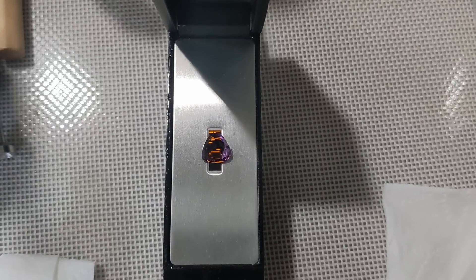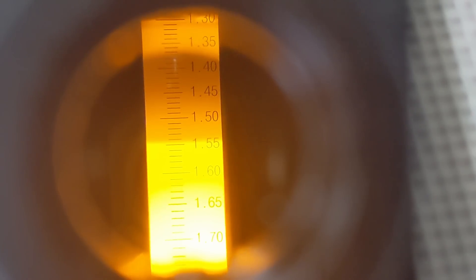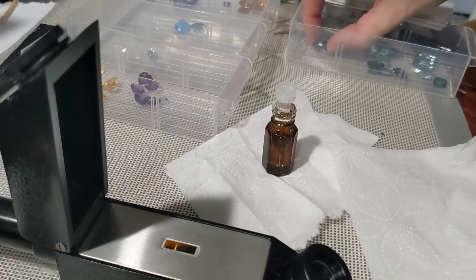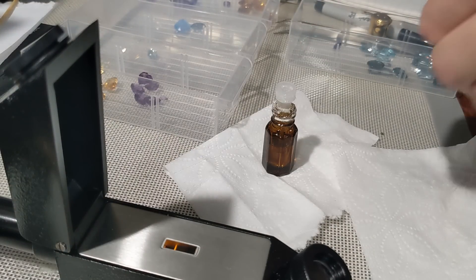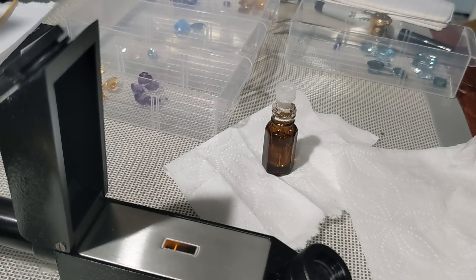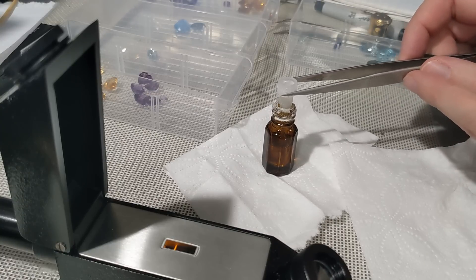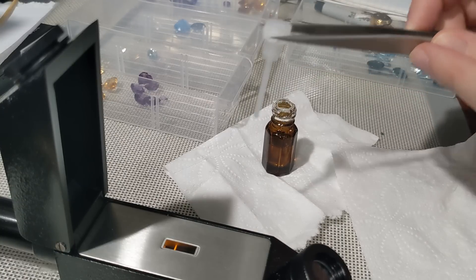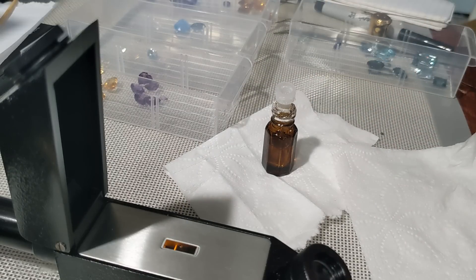If you do get one of these cheaper refractometers, definitely check it against known stones so that you know if it's actually reading accurately, because in some cases that could be an issue. Now there are lots of caveats here: these methods don't discriminate natural from synthetic gemstones. I also only did like one test stone before filming so I'm learning to use the instrument, and did have trouble with a few of the smaller stones later on.